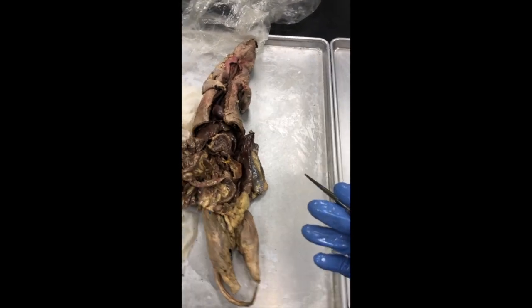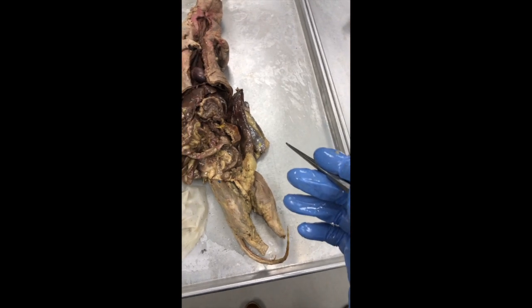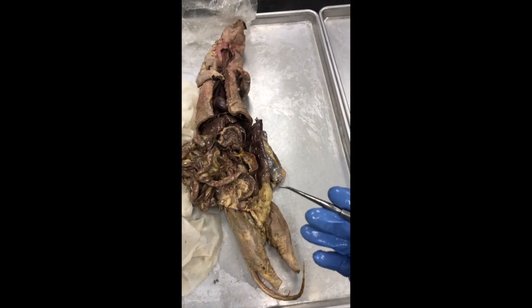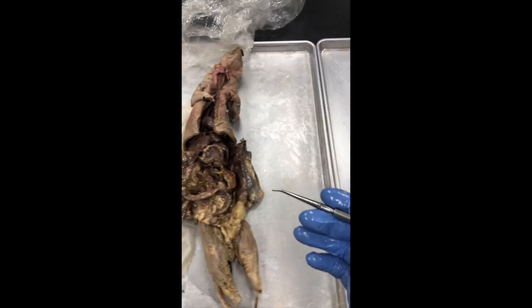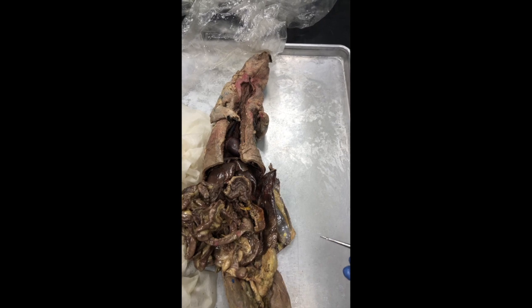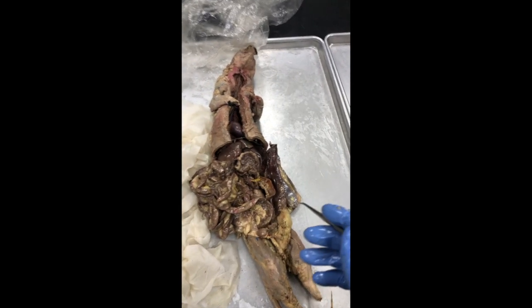Unfortunately, in the little video, in the drawing, we demonstrated female. It does obviously change the location of things a bit, as well as some of the other veins and arteries. With the female, the ovaries would be internal, and I think a little bit easier to spot. With the male, a lot of stuff is buried in this pelvis area, and it's going to make it kind of difficult to find some things. But anyway, we'll jump in and just do the best we can.